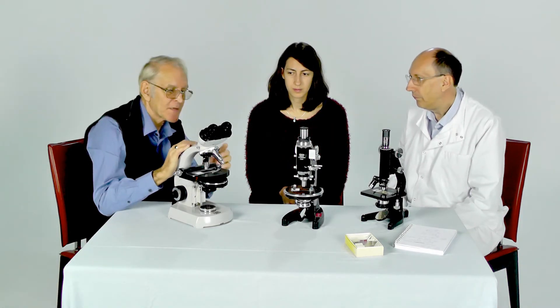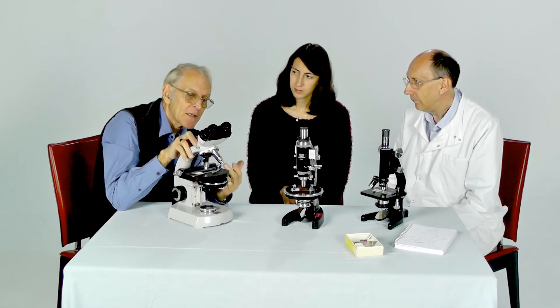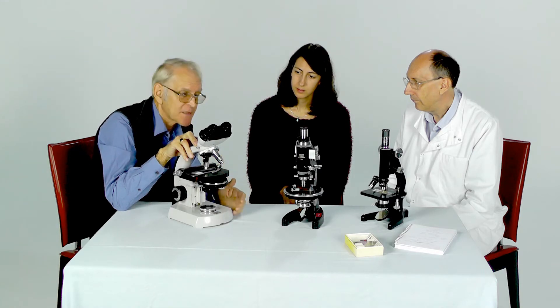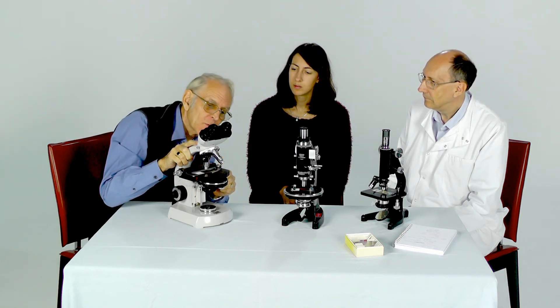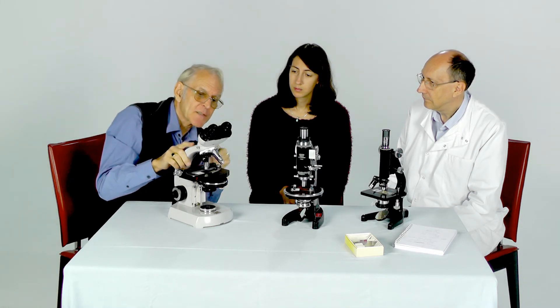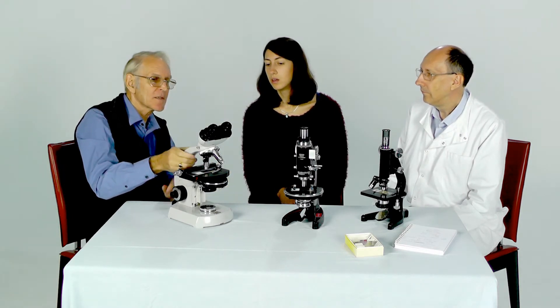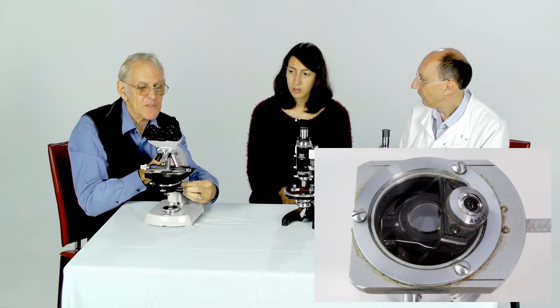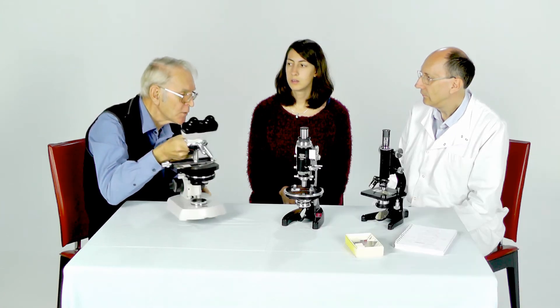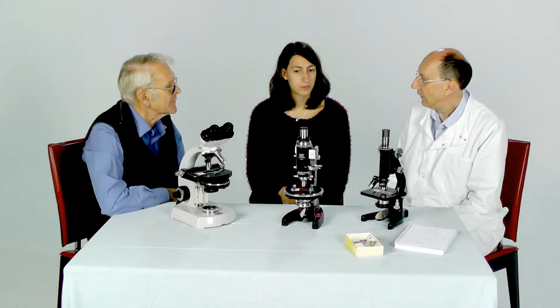Another thing about condensers is that sometimes when you're using very low power lenses, you can't get a big enough patch of light to fill the field of view. Many condensers have what's called a flip top arrangement — this one does. If you pull a little lever across, the top lens actually moves out of position and back in. But you only use the lens out of position with the very low power objective lenses.